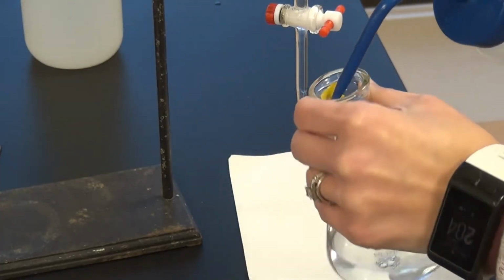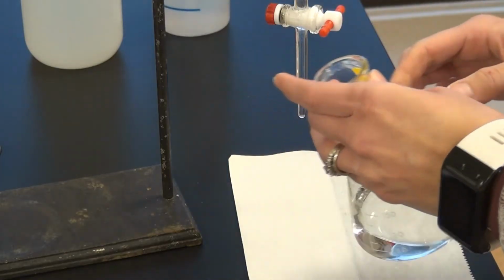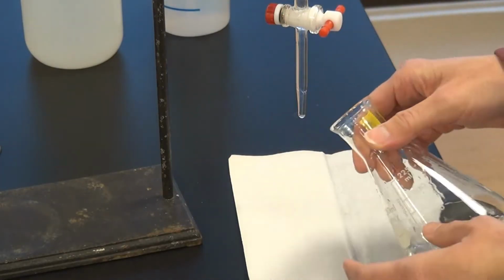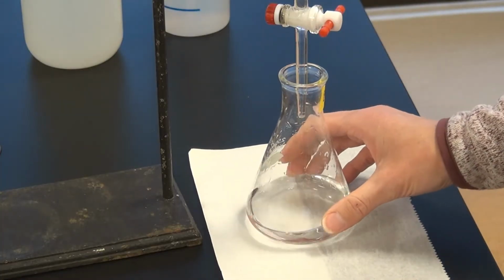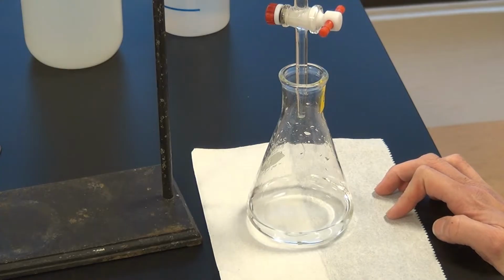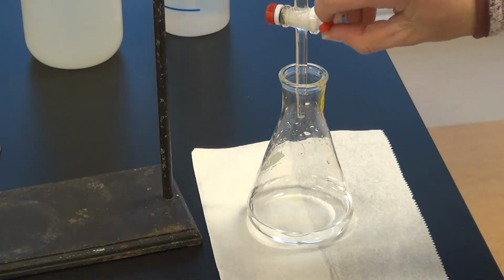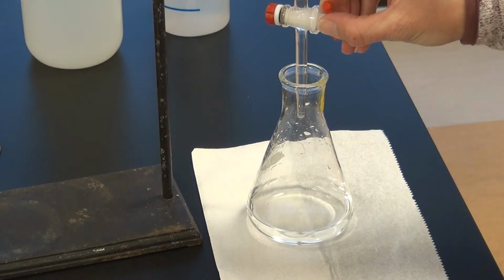And if at any time when you're adding you notice a lot of splashing, or you accidentally bumped it or knocked the flask or something, as lots of splashing come up, you would want to stop at that point and rinse down. Okay, so we are a little below 19 mils, and I think let's add 1 drop here and assess before we do the drop by drop zoom in.